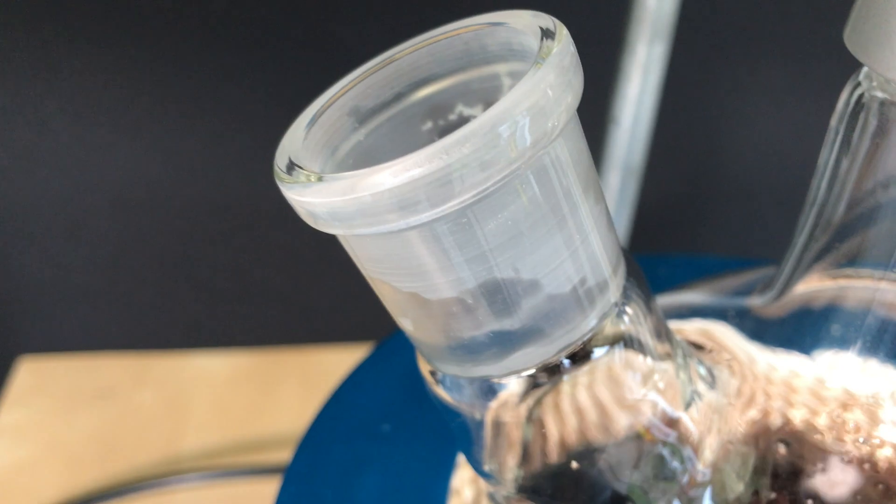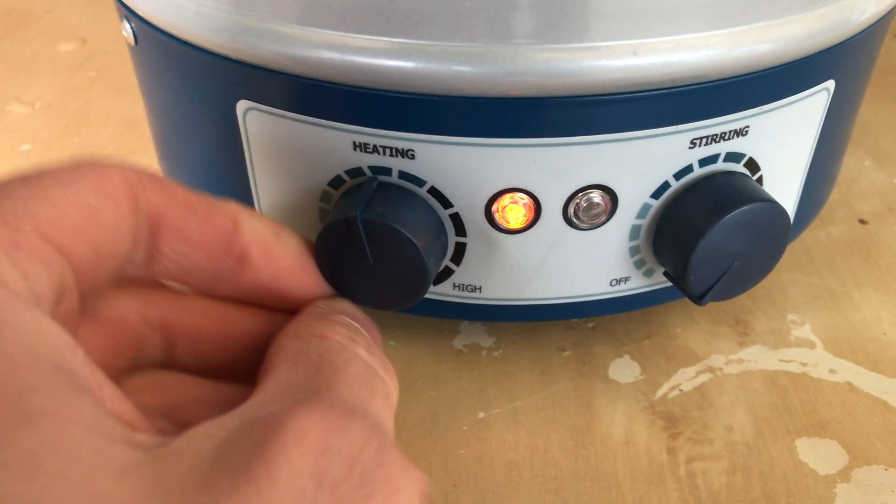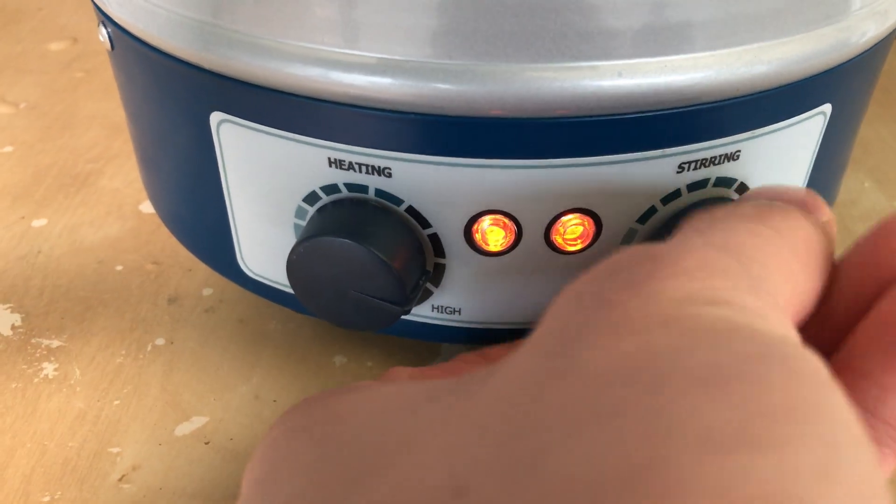It was a problem. It heated up and this might have impacted our yield. The solution turns pinkish black and we're going to see how this is going to impact our yield. I also added the ethanol and then heating and stirring were turned on.